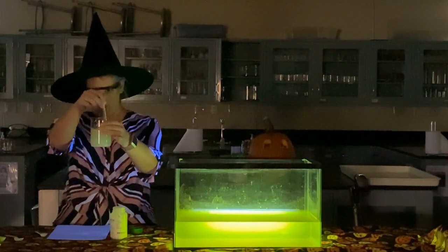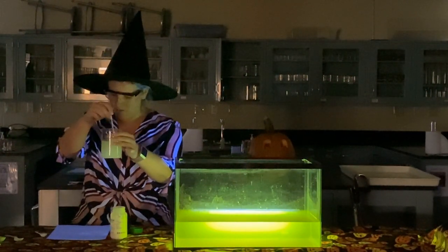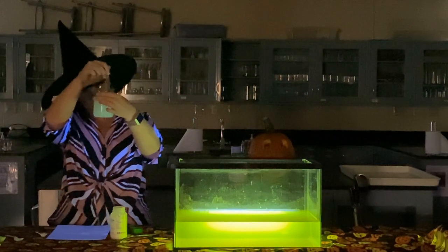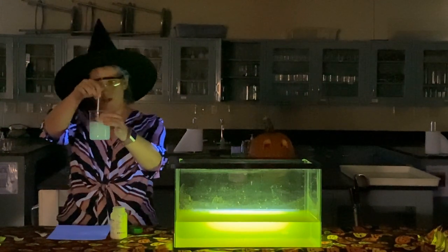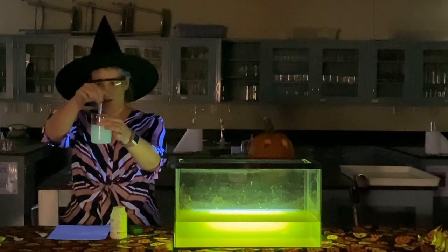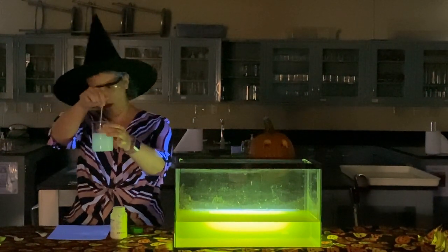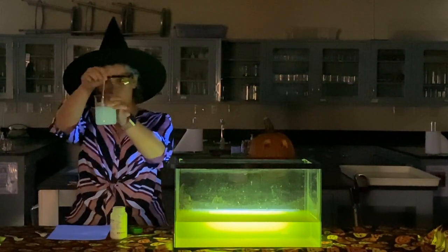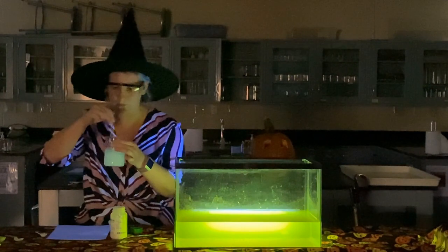Starting to occur there. And this light is emitted during a change from the activated state to the ground state. So that's how we see this light being produced. You should see a nice bright blue color. Starting to change there. See just a little bit of light being produced. No heat is being produced here, just the light.